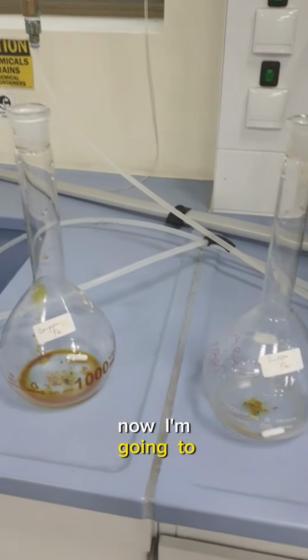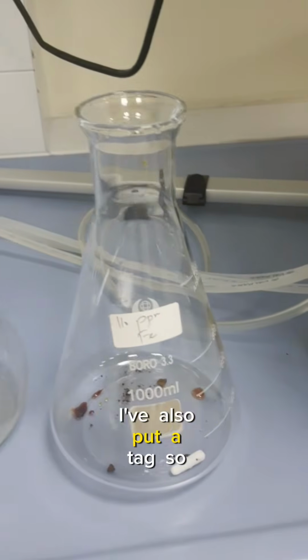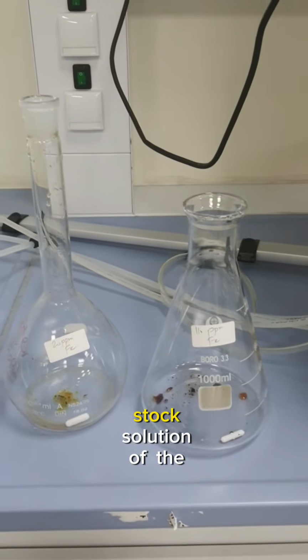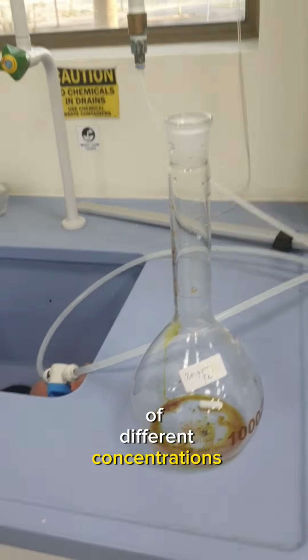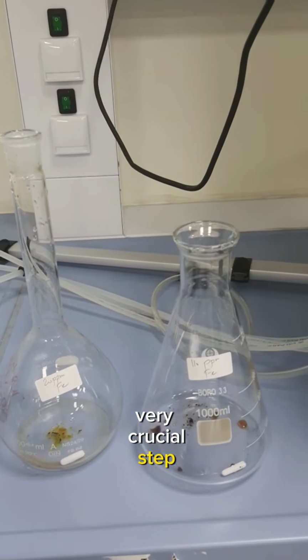Now I am going to add water, and before adding water I have also put a tag so that after the formation of the stock solution of the iron of different concentrations, we are able to differentiate. So this is a very crucial step. So let's add the water.